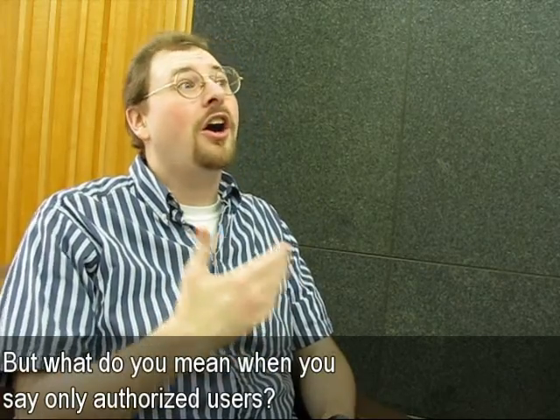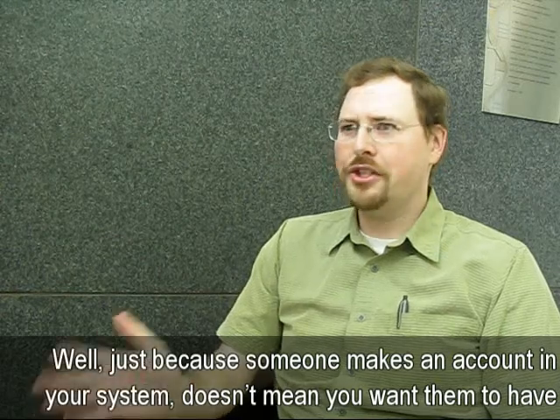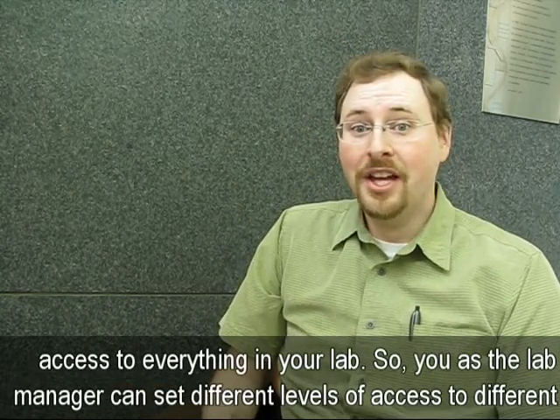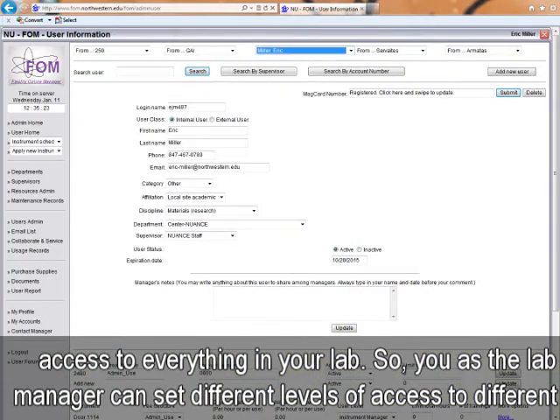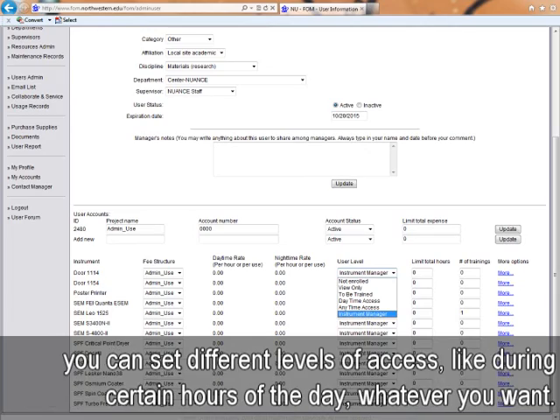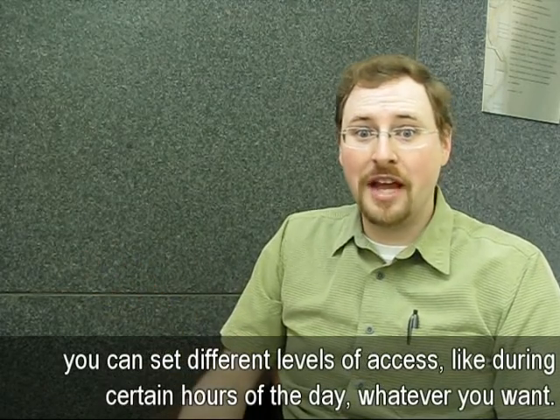But what do you mean when you say authorized users? Well, just because someone makes an account in your system doesn't mean you want them to have access to everything in your lab. So you as the lab manager can set different levels of access to different pieces of equipment. Some equipment might require training before the user gets access, and even then you can set different levels of access, like during certain hours of the day.